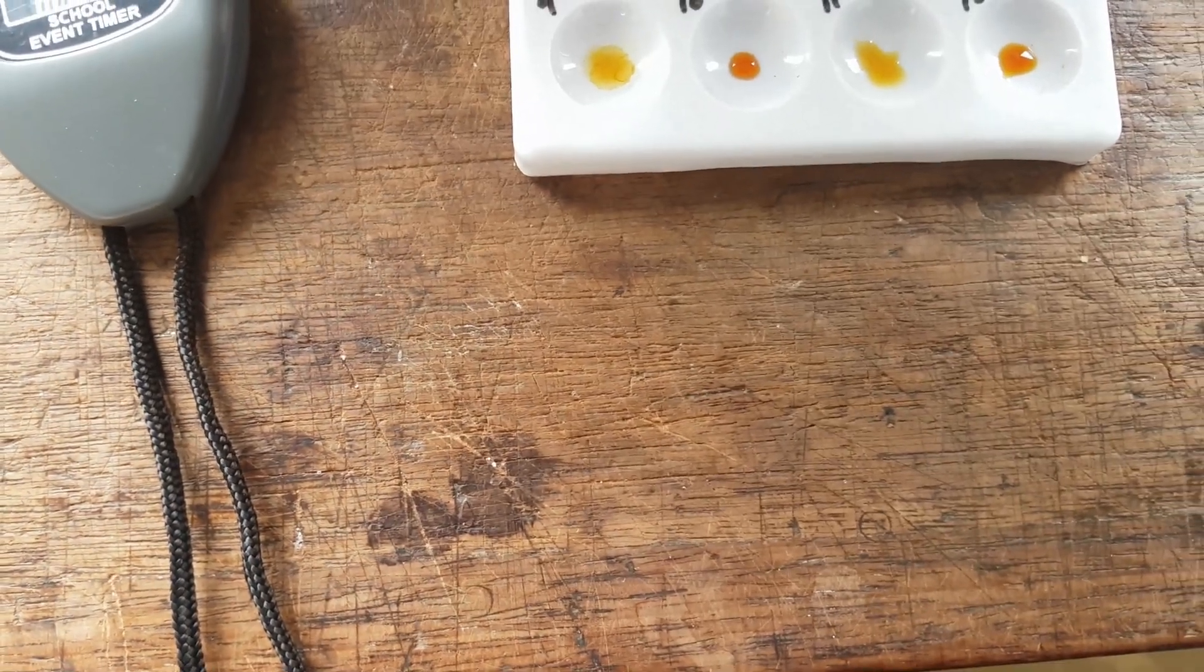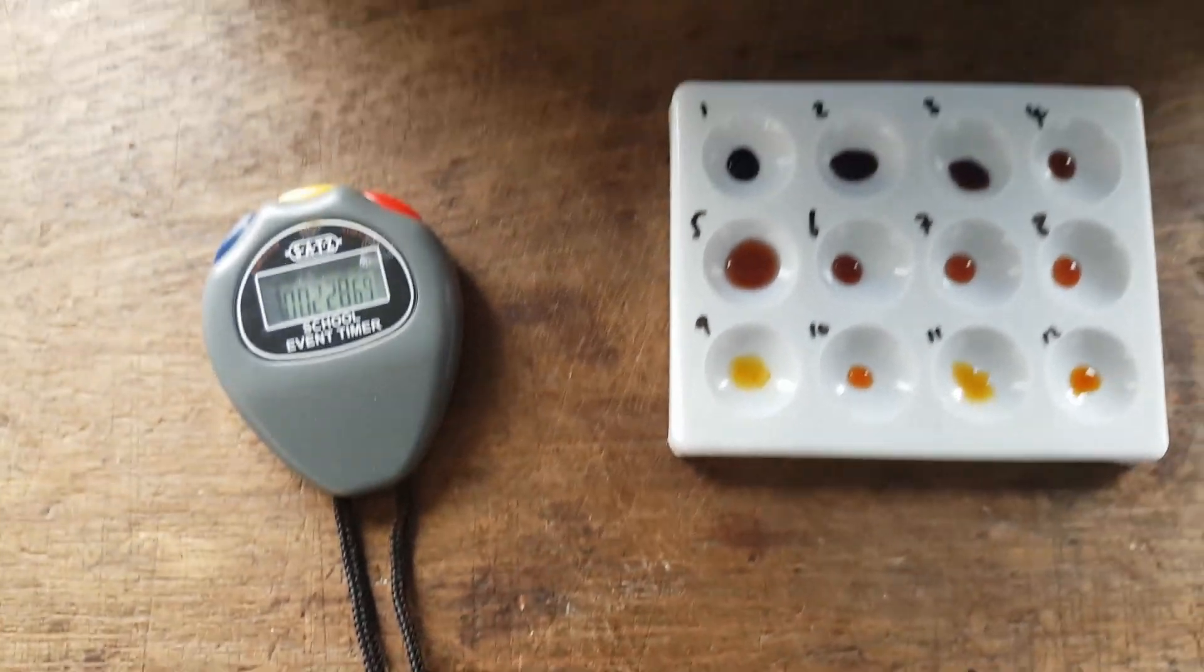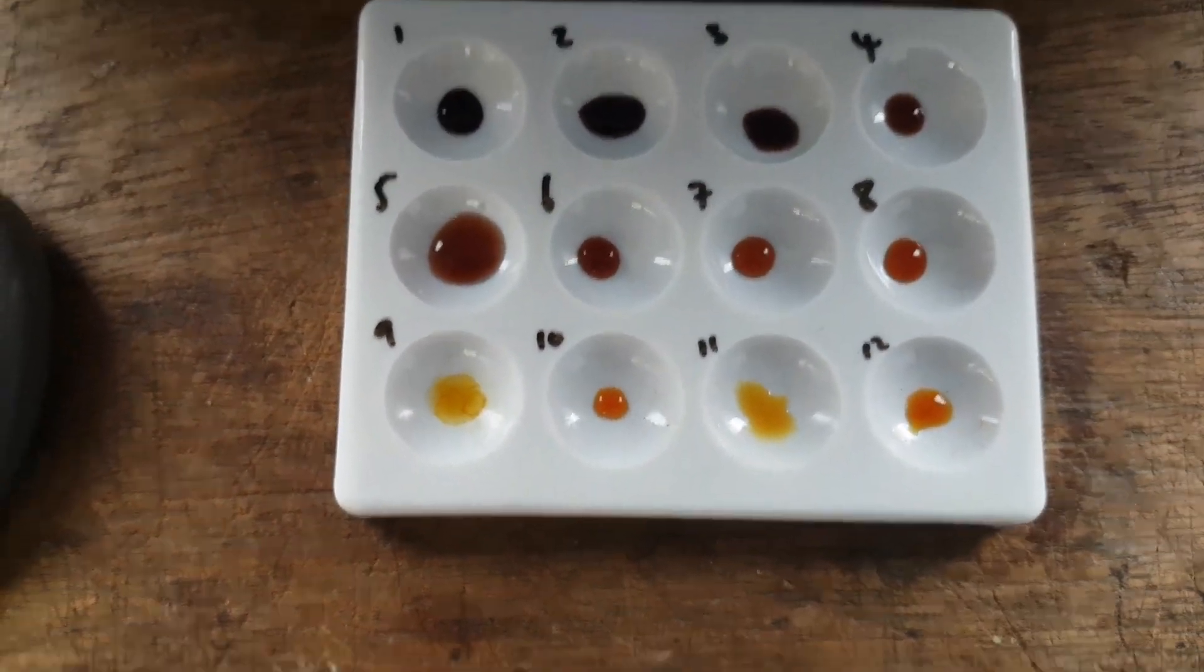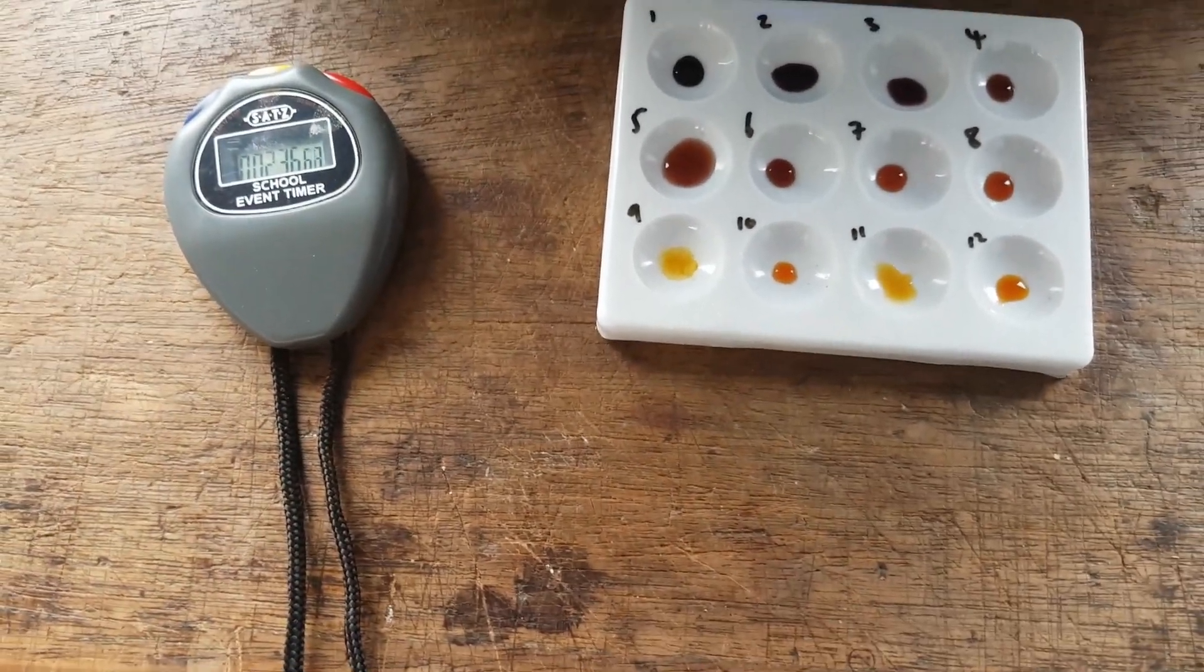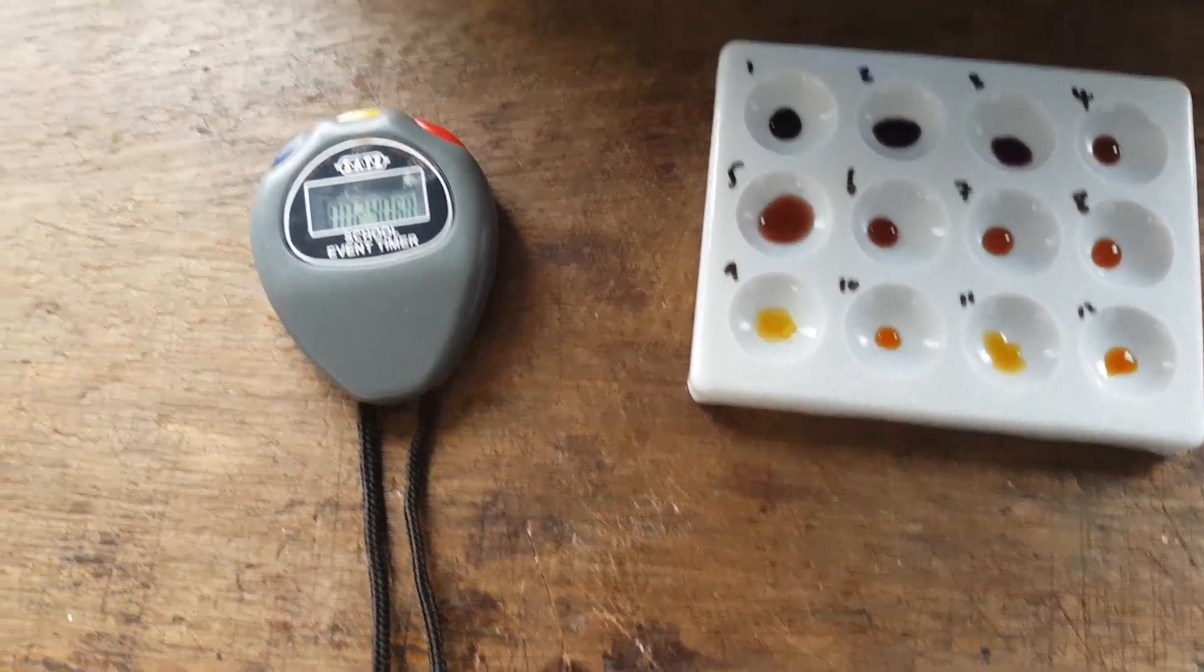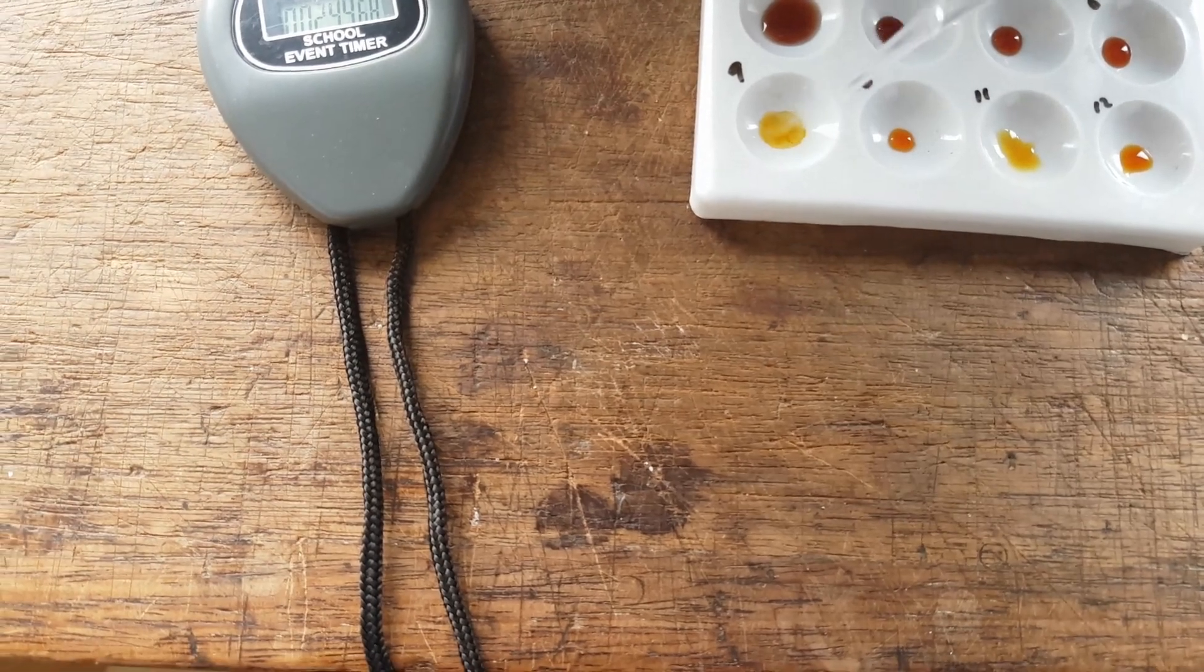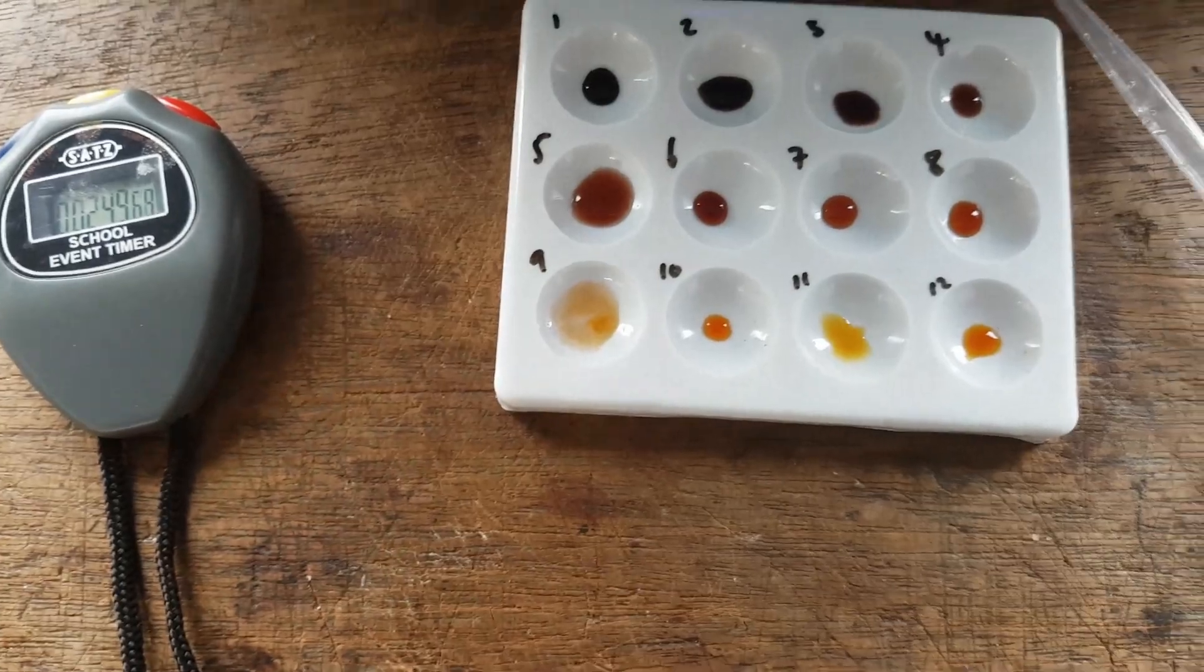So that's 20 seconds gone. And, yeah, I'm going to say, well, it's very difficult to tell. This is one of the problems with these types of experiments. It's quite difficult to tell, but I don't think it's complete yet. So I keep waiting. And this is one of the weaknesses of these experiments, guys, is that it kind of gets a bit difficult to see. And that is stopped. That is definitely stopped as far as I'm concerned. So I'm going to stop.